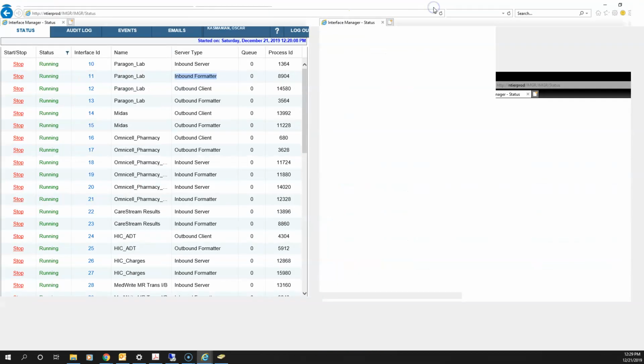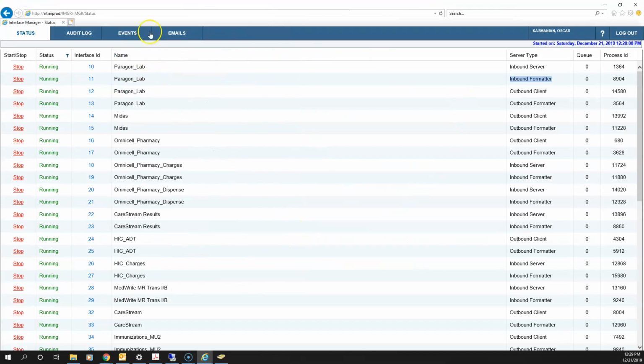Okay, so we log into the interface manager, right? We see one interface here, right? This is one interface, inbound, and a second interface, outbound. Okay. Again, I listed it over there. The one for the orders are 12 and 13. That's the outbound.